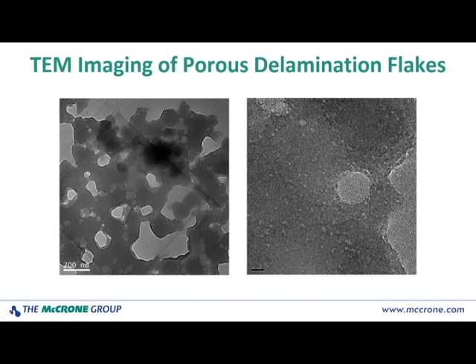And this is just to illustrate some of the differences in texture that you might see. This sample was actually looked at in another microscope, another TEM at the University of Illinois at Chicago. And this was a case where extreme delamination had occurred. And you see that the glass is very badly degraded, very porous. This is advanced delamination. And on the right, the scale bar there is 20 nanometers. You can see that a lot of these holes are actually extremely small.